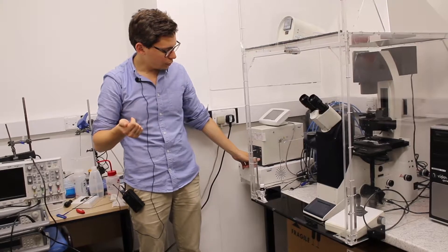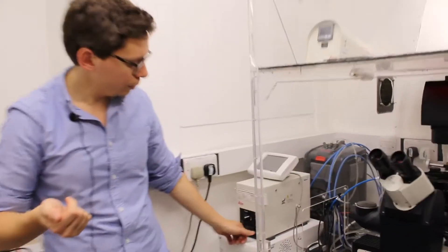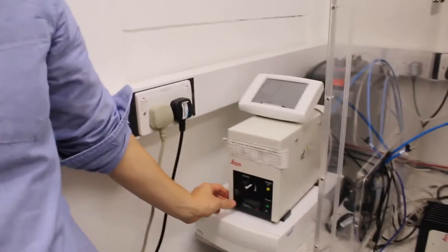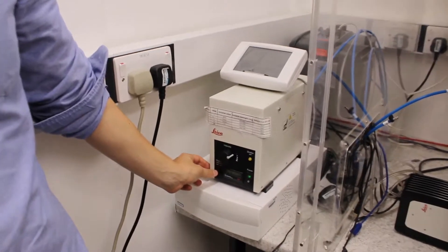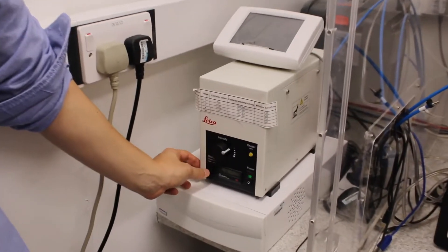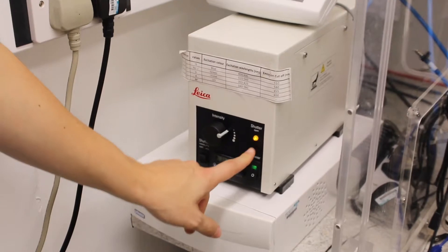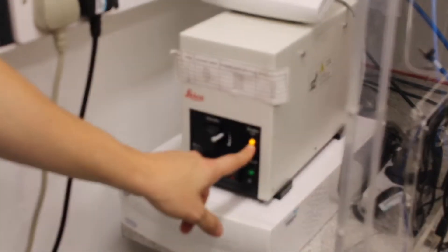So for that you just turn on here the power on, and then there is a shutter here that for now is closed, and if you press it's going to be open and the light here turns on.